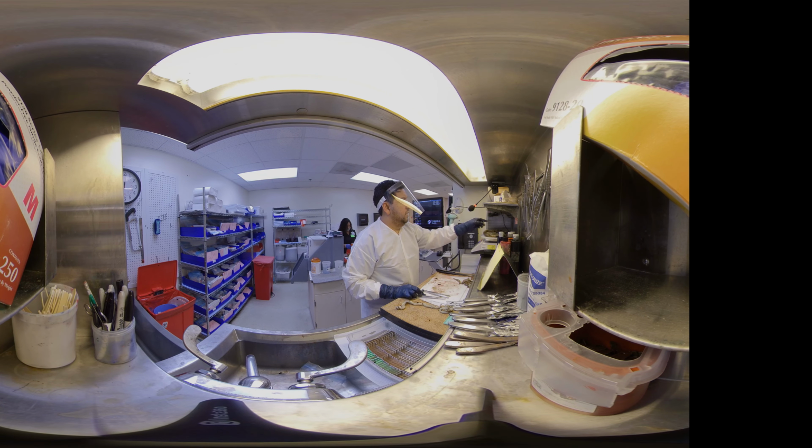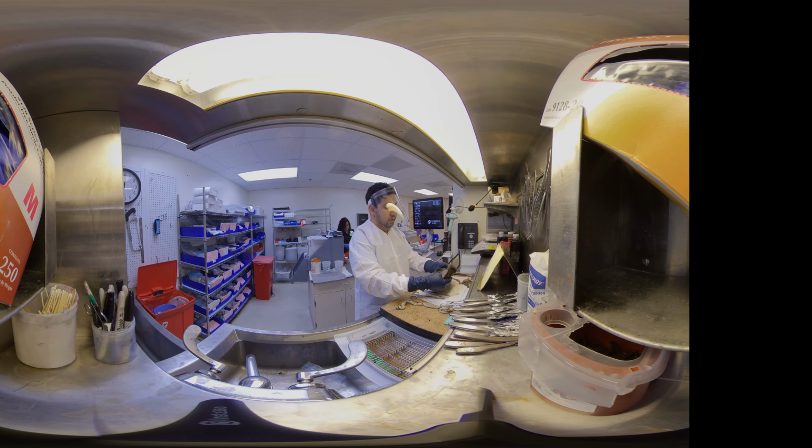Is a 595 gram, irregularly shaped, intact and complete singleton placenta, which measures 22.0 by 18.5 centimeters after trimming.